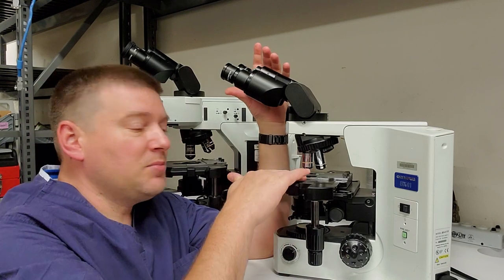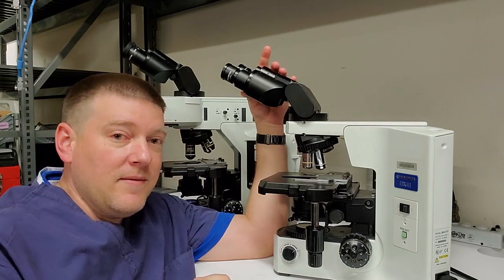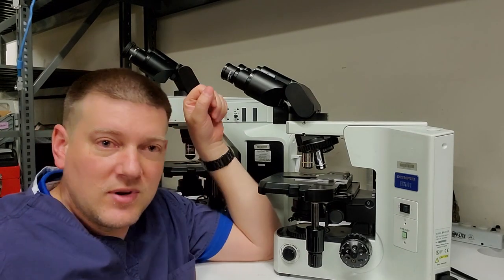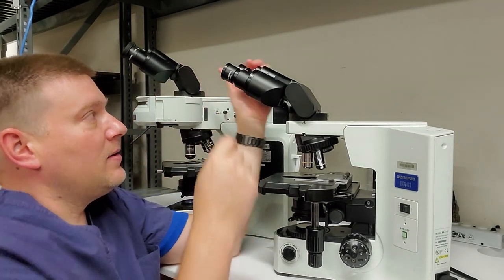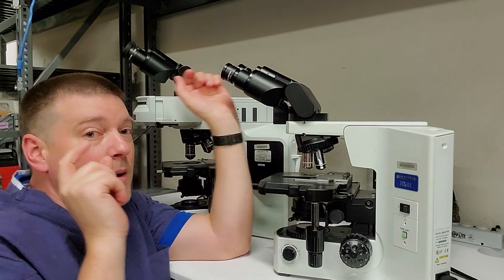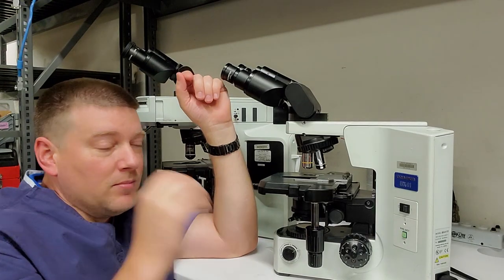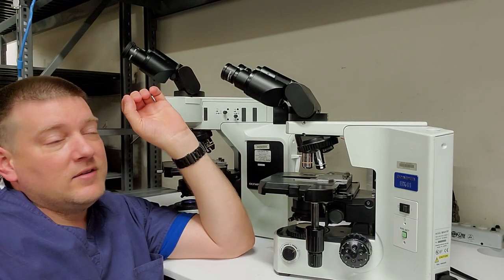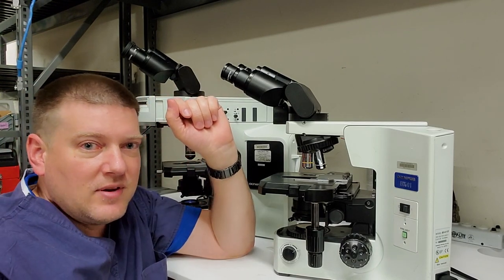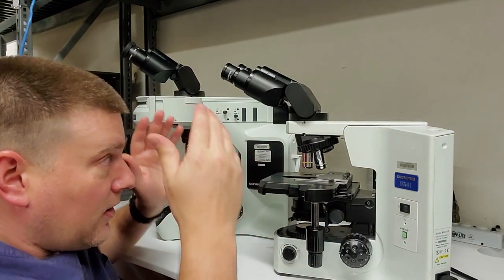So what you are going to do is you put your sample here, you adjust it so that it's in focus on your one eye, and on the other eye, you're going to adjust it so that it pops with the 3D effect, the stereoscopic effect, because everybody's vision is different. So it's a quick and easy way of doing it. Now with surgical microscopes, both oculars are usually adjustable, but with these ones here, they've made it simple. One of them stationary, you adjust your sample until it's in focus, and then you adjust one ocular until it really pops and comes into stereoscopic 3D. So that is the oculars.